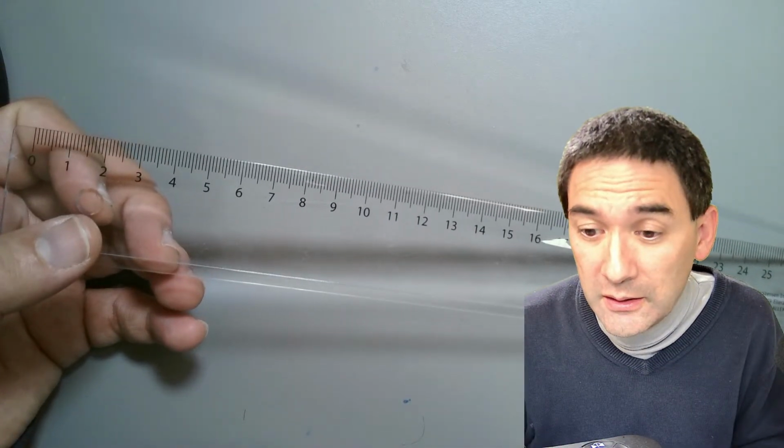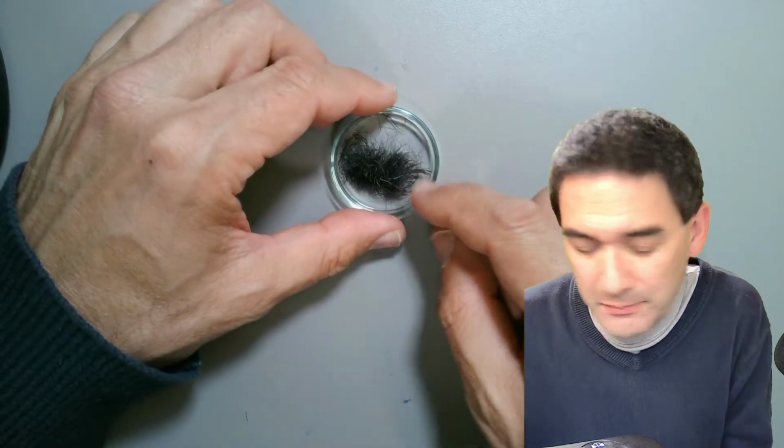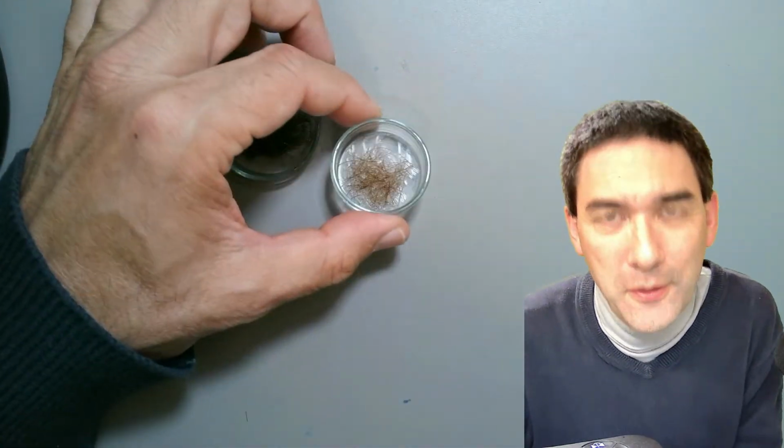Okay, checking the time, 20 minutes. Look what I've done here. Next thing that I want to show you. Look, you've seen this already. That's my hair, right? You see that a little bit. It's white. And look what this is. This is also my hair. Why is it so much brighter?